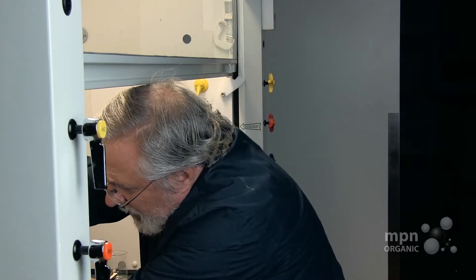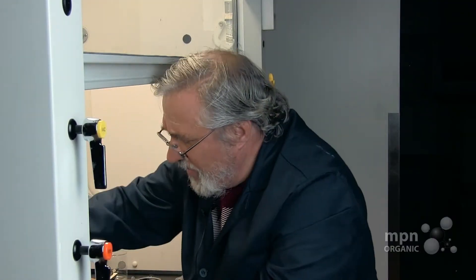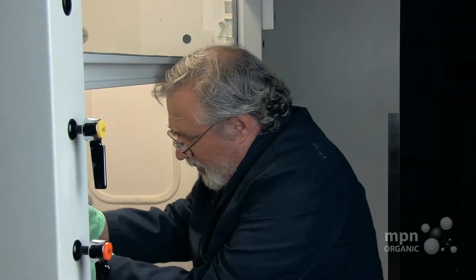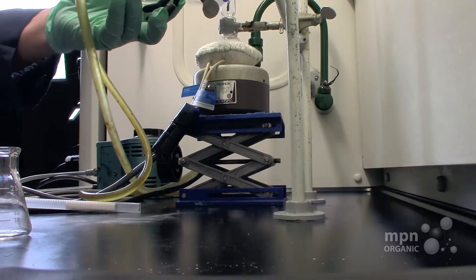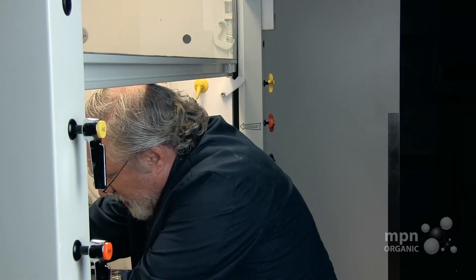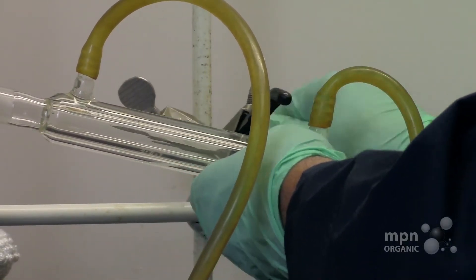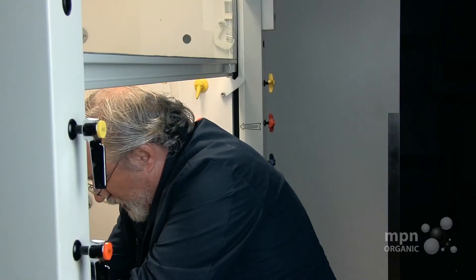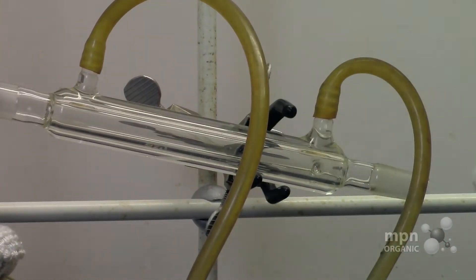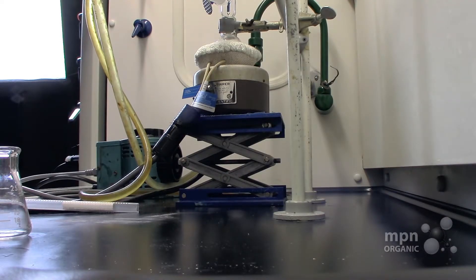I like to put a Keck clamp on this — there, it's on tight. Now sometimes these are rather heavy, so I like to put a little clamp on the end of this. I use the three-prong clamp for this operation, and I basically just cradle it in my three-prong clamp and that's pretty steady.